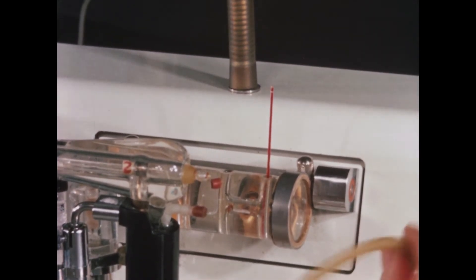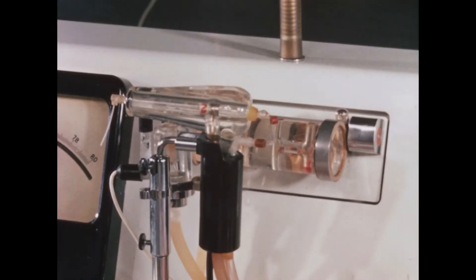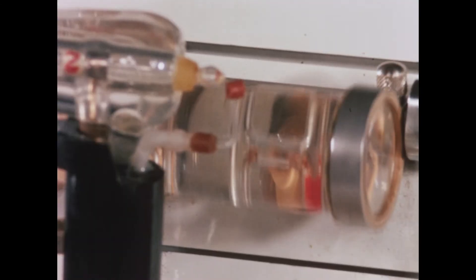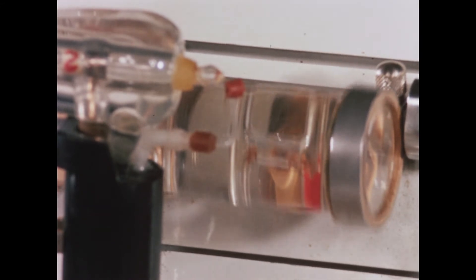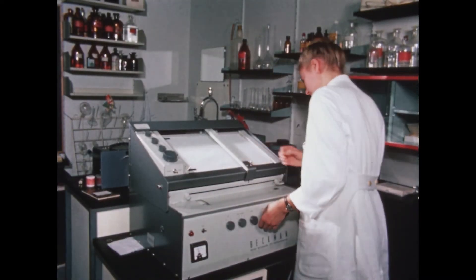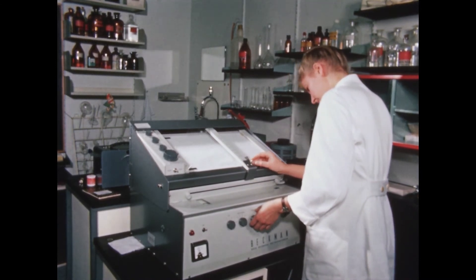In addition to all the apparatus used in the daily routine, a great deal of special equipment is required for purposes of control and further advances. Here you see the self-recording spectrophotometer in action. Automatically, it records graphically the quantity of light absorbed by a sample at the various wavelengths of the spectrum. This apparatus is also used for special routine studies, for instance, for determining hemoglobin derivatives in the spinal fluid, which is of importance in diagnosing hemorrhages in the central nervous system.